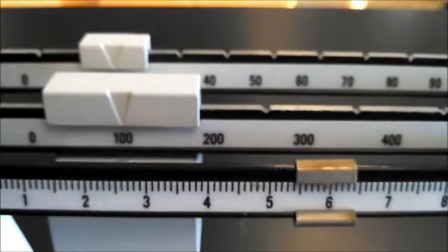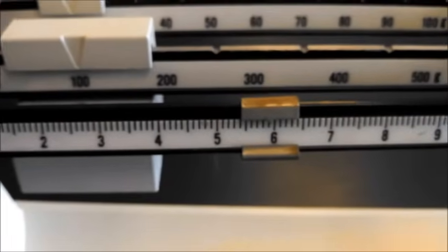Now, what are the units for mass? Grams. So, we'd want to report this as 125.9 grams.